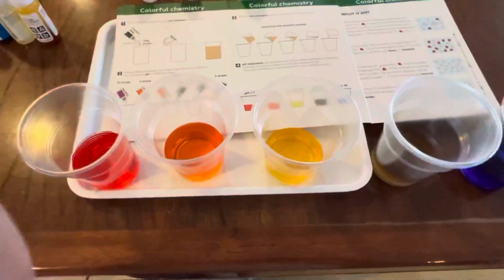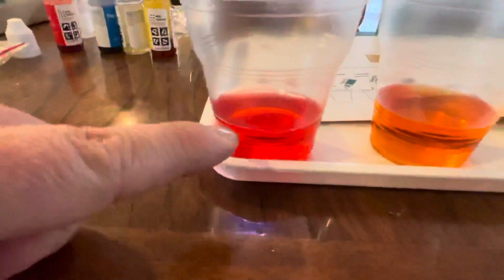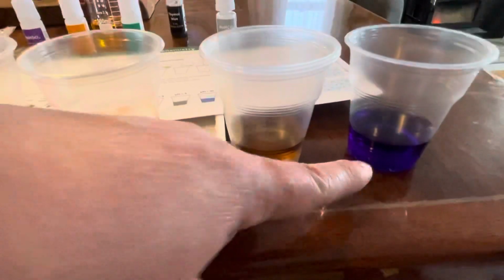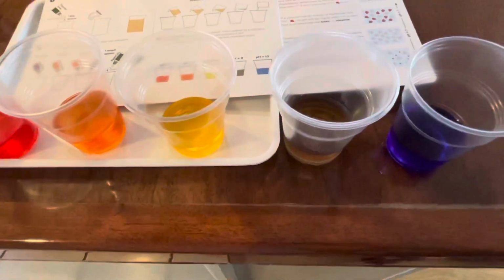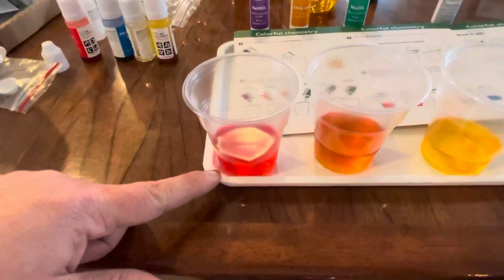So then when we add the indicator dye, we're going through, and each of these started this original color and then ended with pink. What's this, buddy? Orange, yellow. This is like a greenish gray. It's a brown. Yeah, brownish gray. And then a purple. So in this case, our purpley blue is our indicator that's now the pH of over 10, and then all the way down to our pinky red, and that's a pH of less than 1.